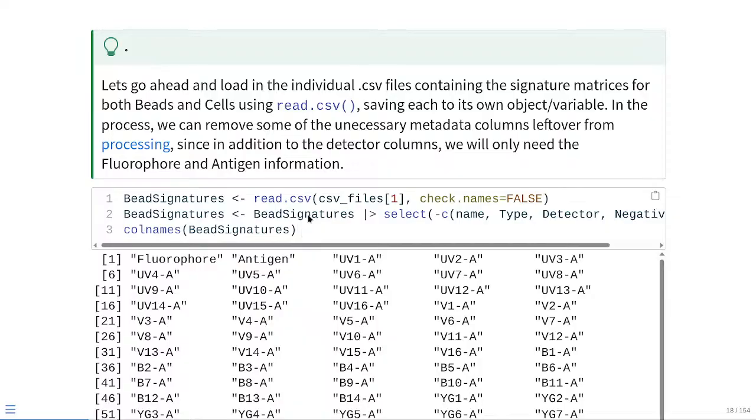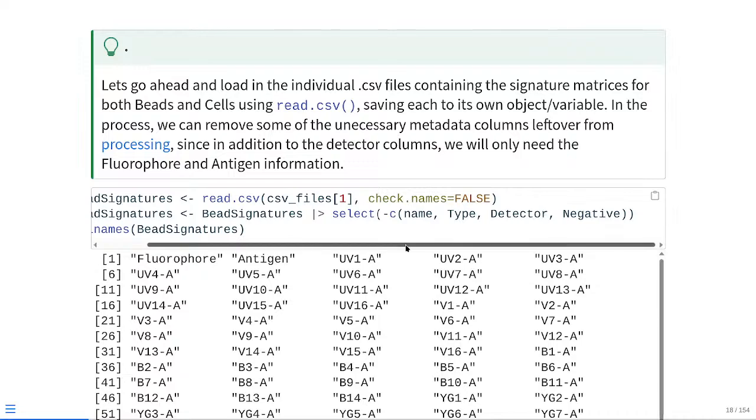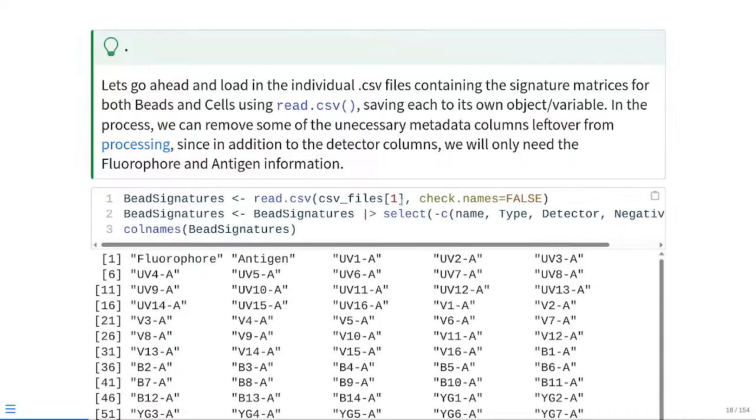From there, if you remember from the walkthroughs for signature matrices and signature comparison, we had a few extra processing columns: name, type, detector, and negative. Those we don't actually need for unmixing, so we can remove them using the dplyr package's select function, just adding a negative in front, basically dropping them in this circumstance. If we check, we can see we're left with just the fluorophore columns we're interested in for the detectors, and then the fluorophore and antigen metadata columns.